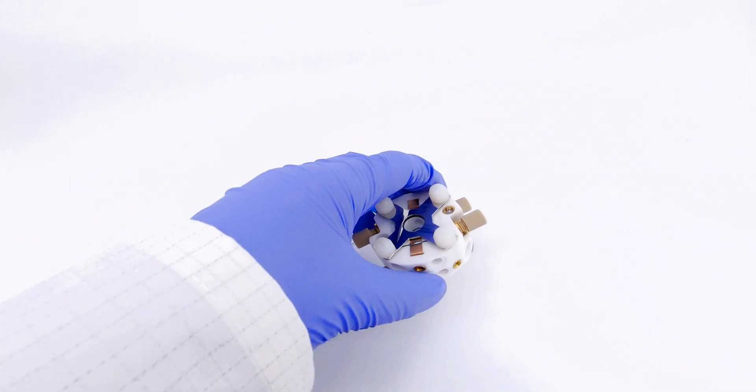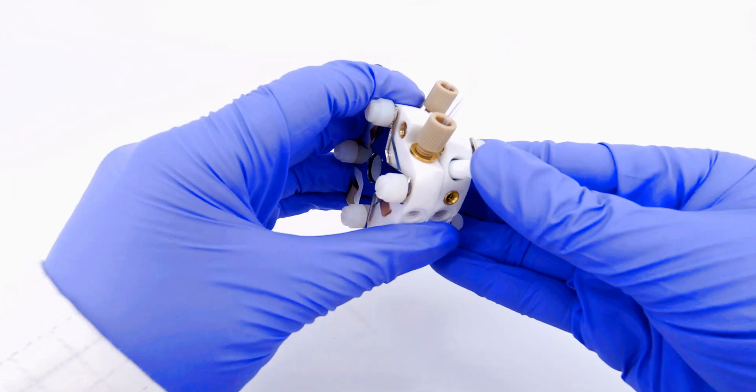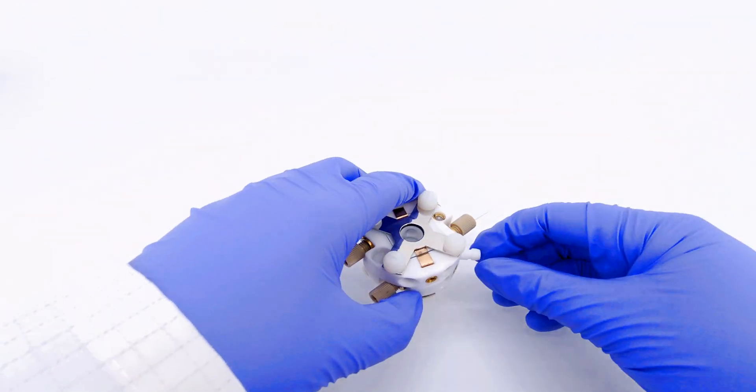Place plugs into ports on both cell halves and then counter or reference electrodes into the top ports.